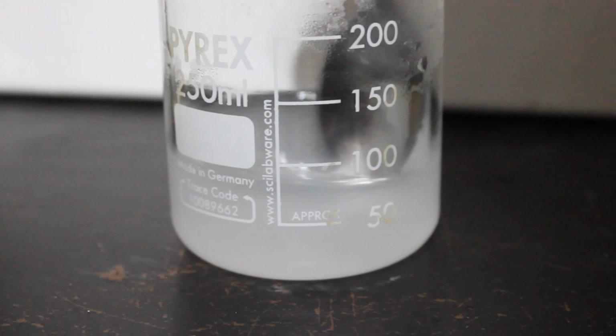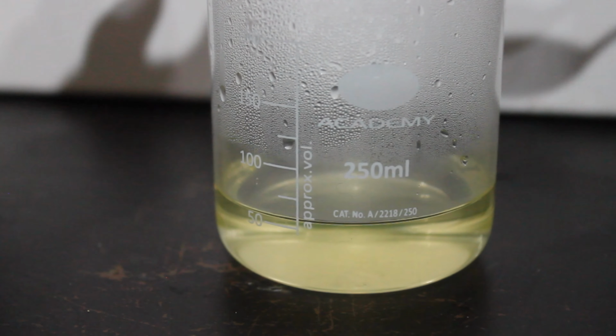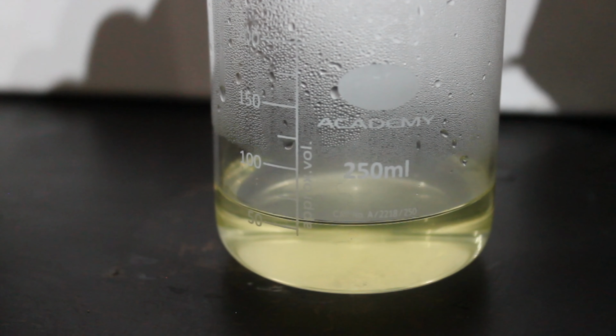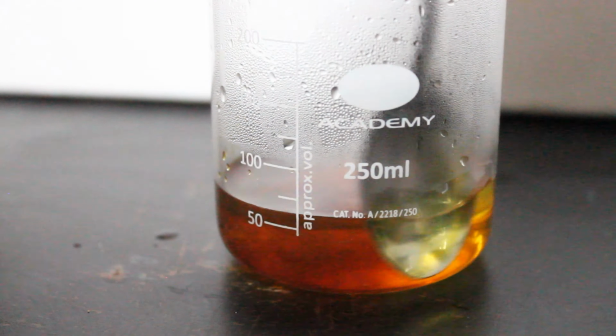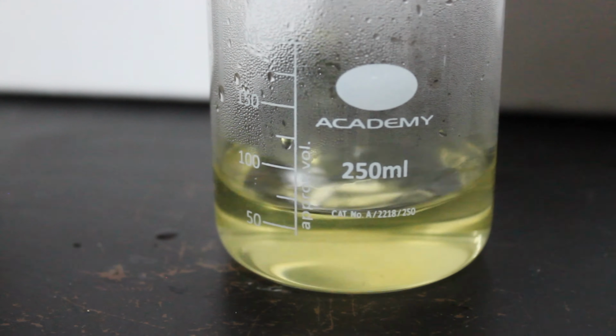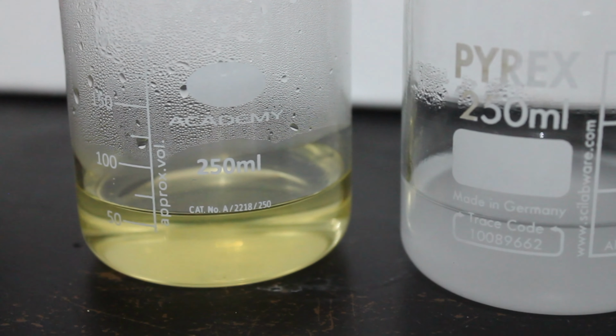We then go back to Solution B. We now need to add a teaspoon of Lugol's iodine solution and stir this in. The colour of the iodine solution quickly dissipates. This is because the iodine is being converted into two colourless iodide molecules as it reacts with the vitamin C.